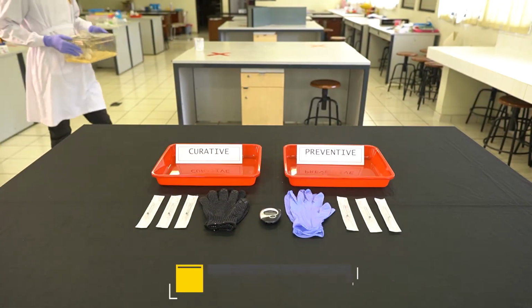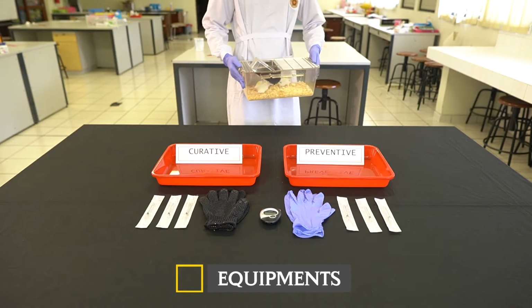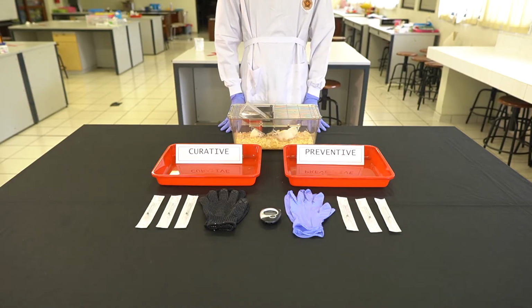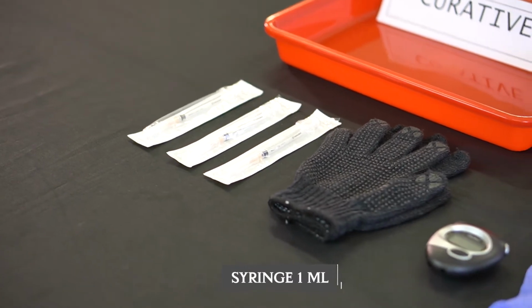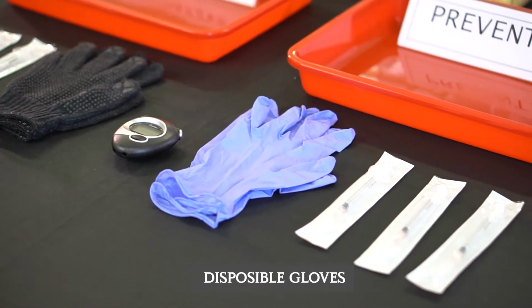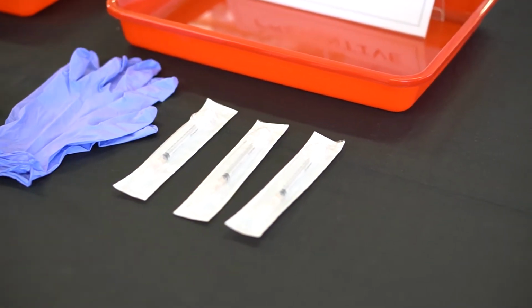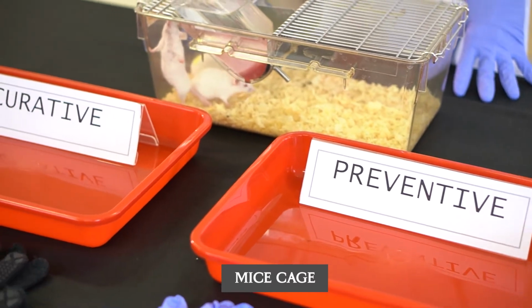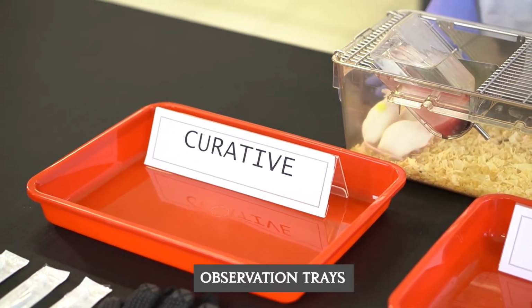The tools and materials used are as follows. Equipment: syringe 1 ml, gloves, stopwatch, disposable gloves, mice cage, observation tray.